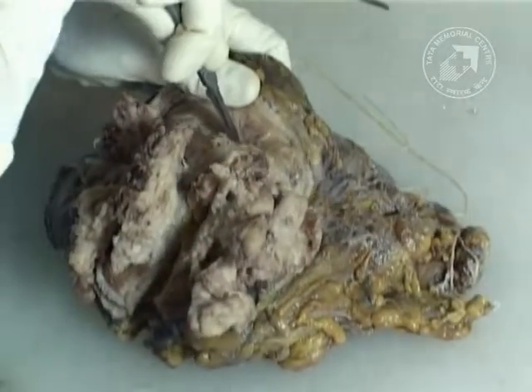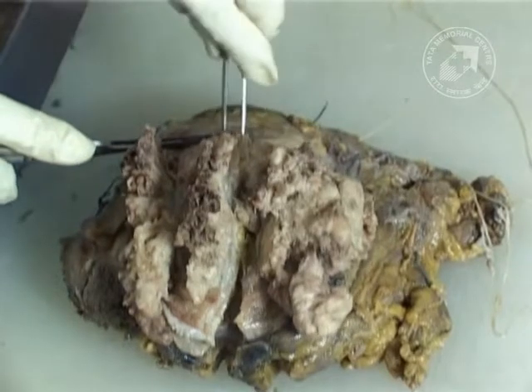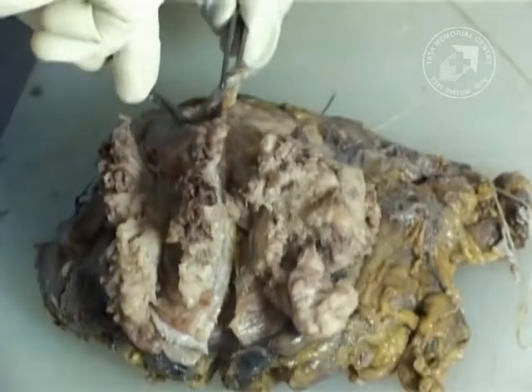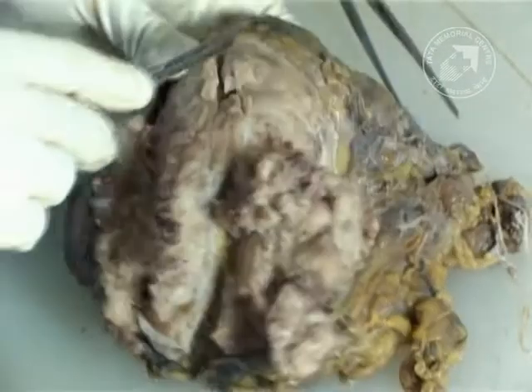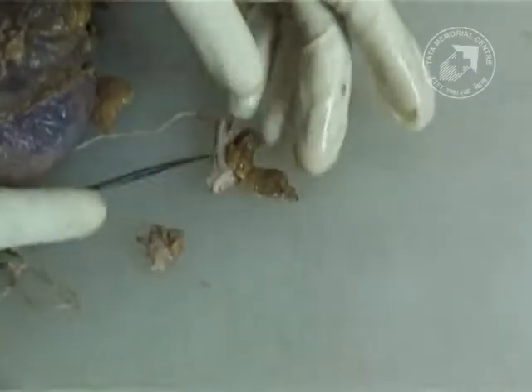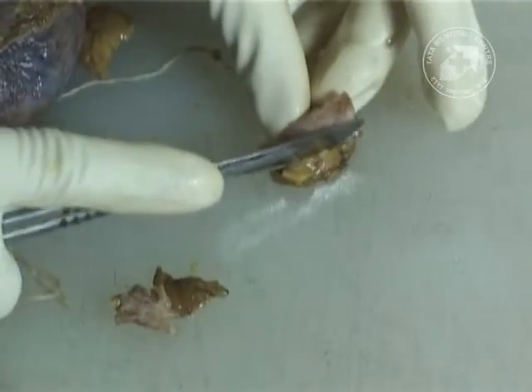We begin by taking a section of the right lateral wall which is uninvolved, as you can see here. We try to sample all the walls of the bladder — both the involved and uninvolved ones — to look for any carcinoma in situ changes in the uninvolved parts. You can see the white muscle coat and the brown mucosa.